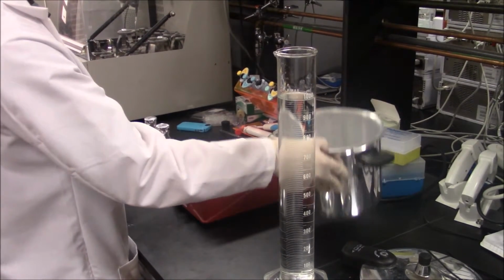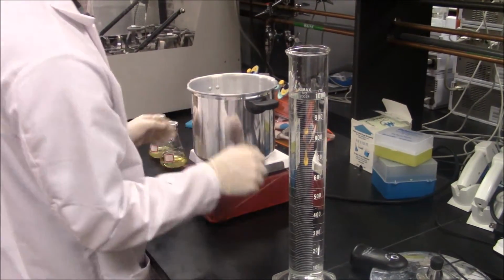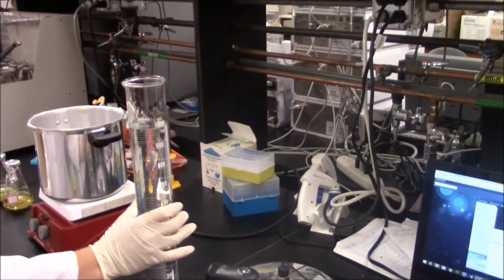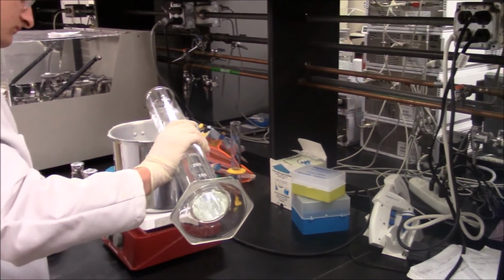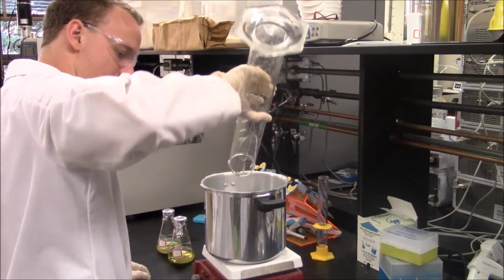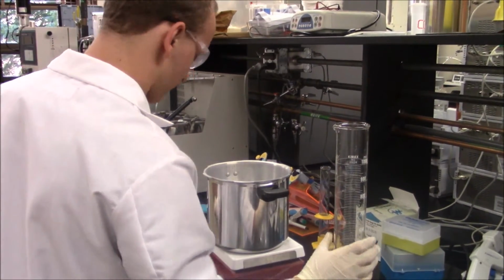Both flasks need to be sterilized before the addition of yeast to ensure that nothing else is consuming the glucose during fermentation, like bacteria contamination from the lab. Sterilization should be accomplished using the pressure cooker and a hot plate. Conduct this step in a fume hood if available, otherwise on a lab bench.